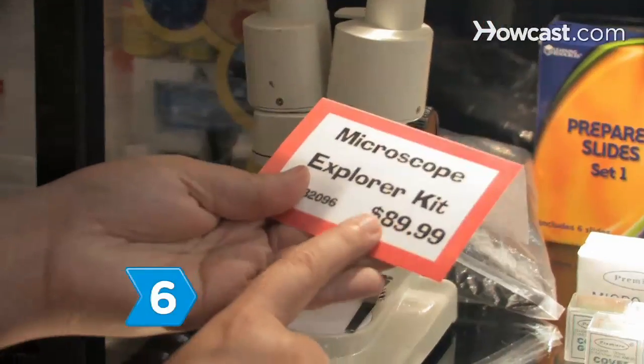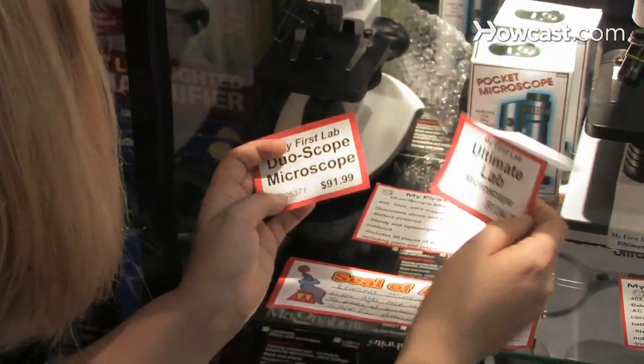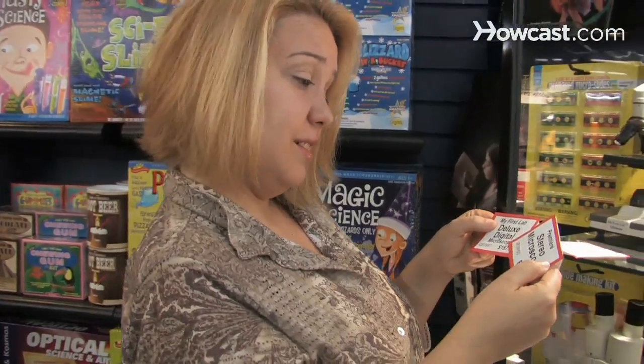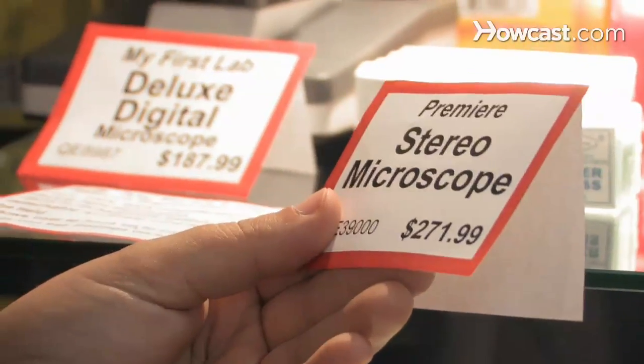Step 6. Consider your budget in your decision, noting that a toy model costs about $100, while costs for adult and research models run into the hundreds of dollars.